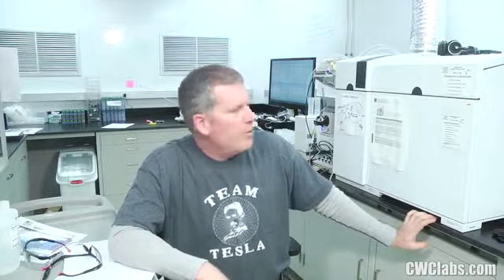The big thing to keep in mind on this instrument is don't take shortcuts. Don't think, oh yeah, I can use that peri-pump tubing for a year. No, you can't. You need to swap it out. It's going to interrupt the run. It's going to cause a problem. Don't think, oh, I don't need to make fresh standards every day. Yes, you do. You absolutely do. I make them fresh every single day. I do not use standards that have been left out overnight. Even if they're capped, I don't use them.